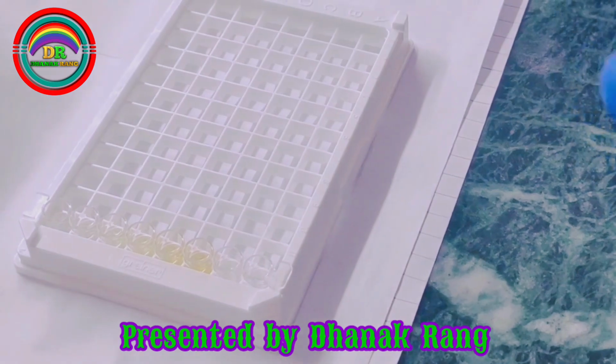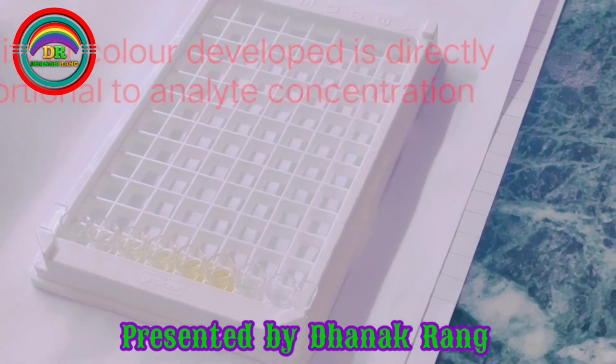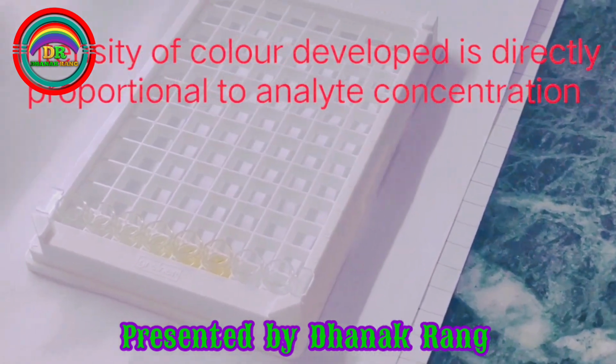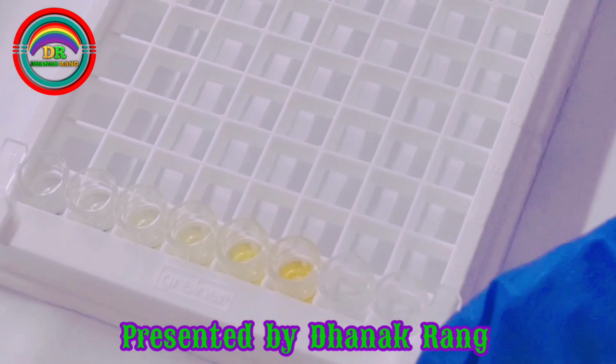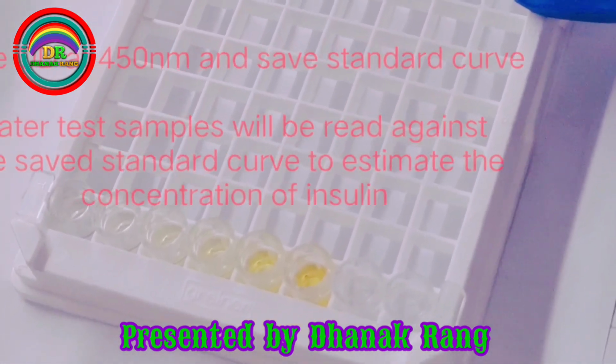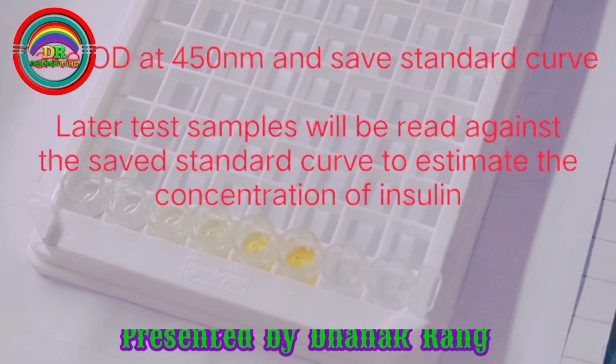As you can see, the intensity of the color developed is clearly visible. So we'll also take the OD in a spectrophotometer and we'll make the standard graph according to the OD that we'll get.